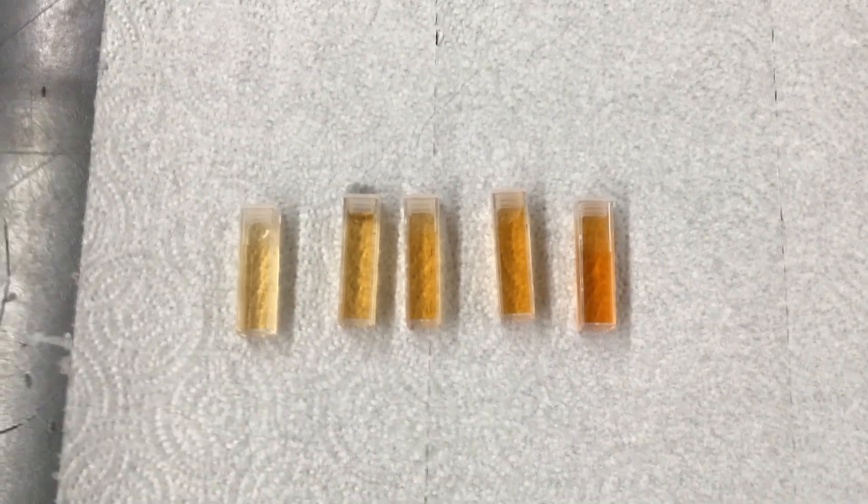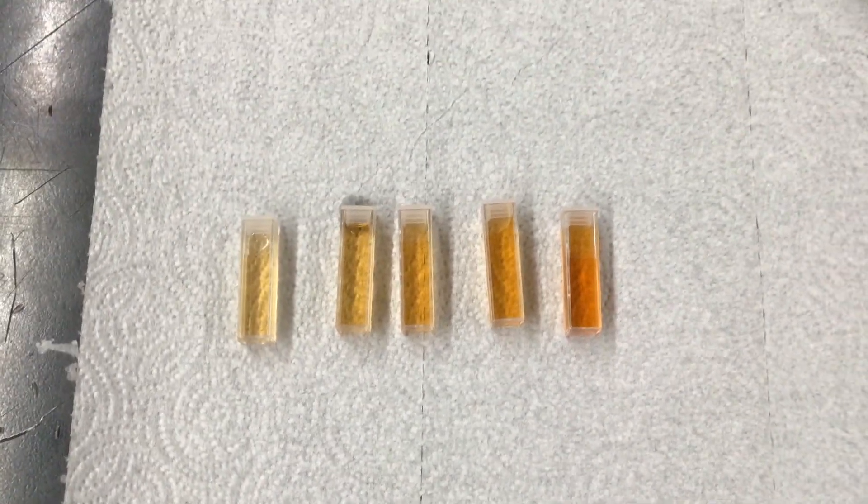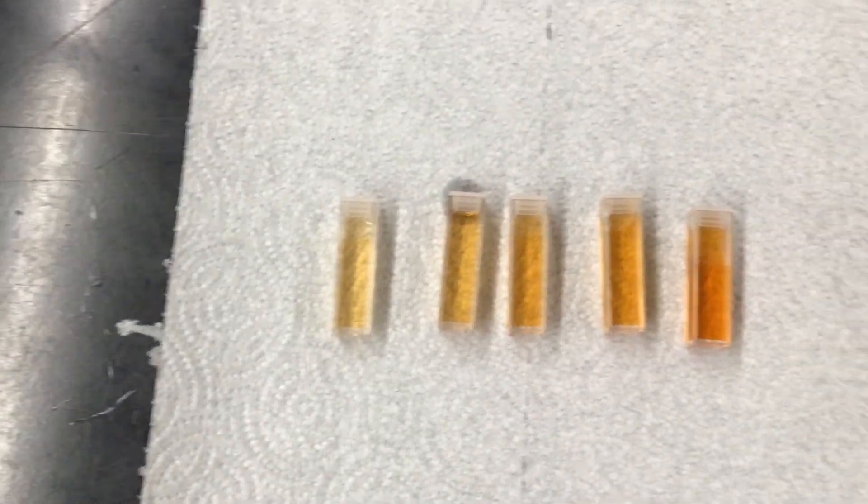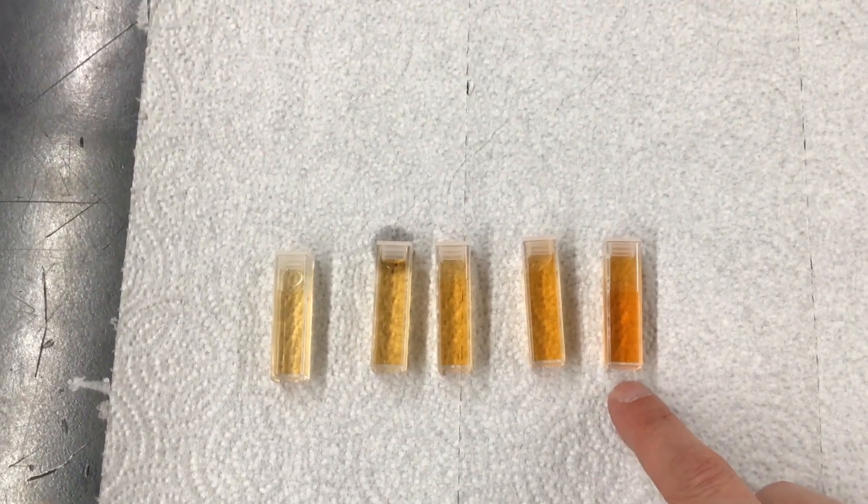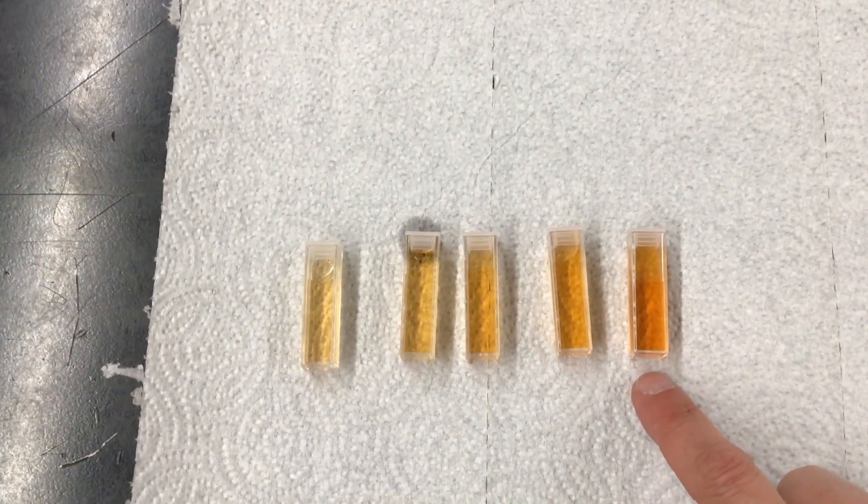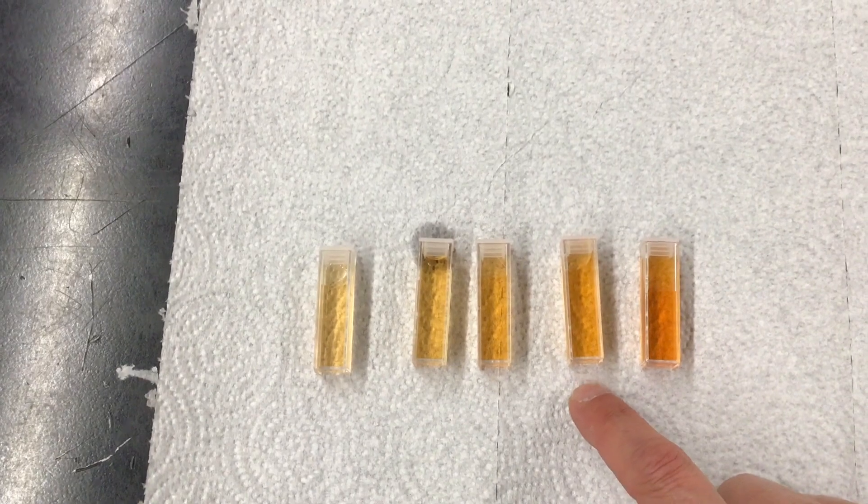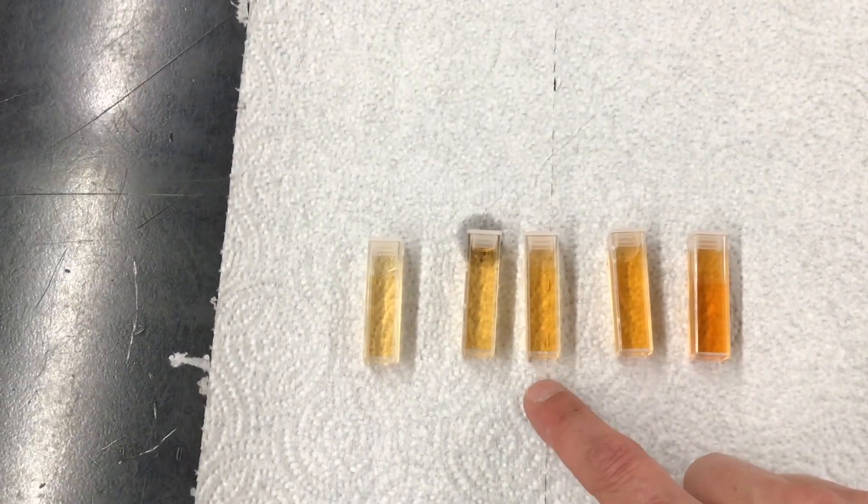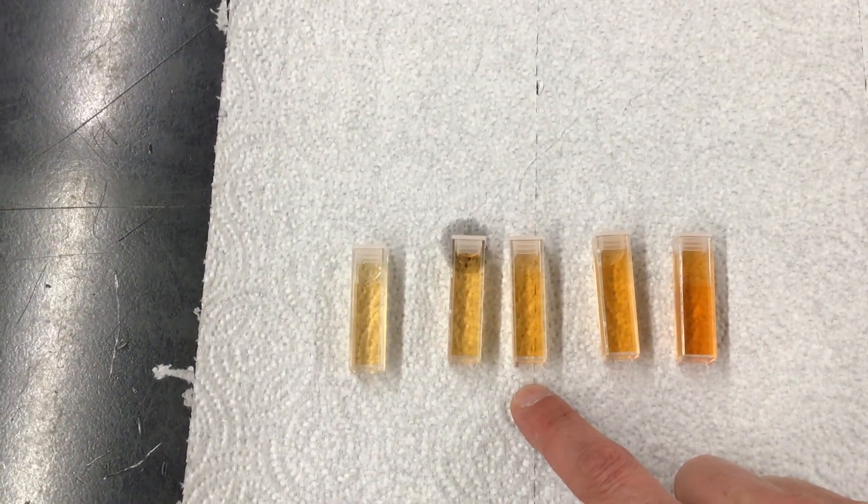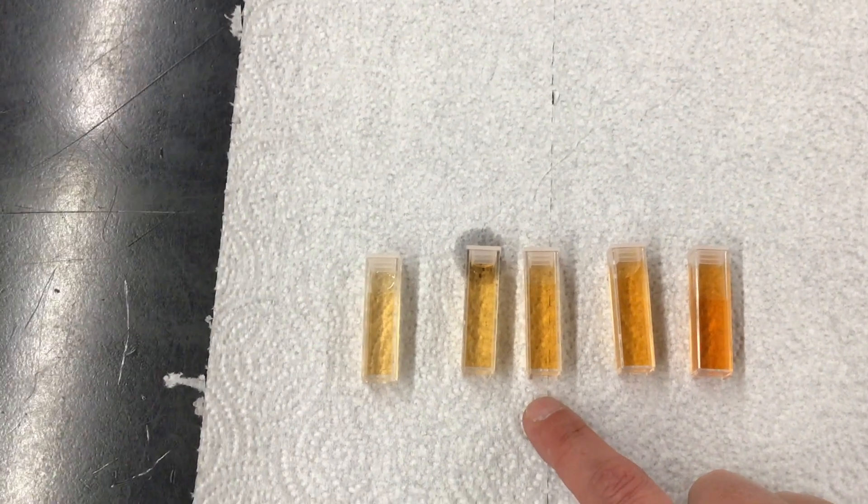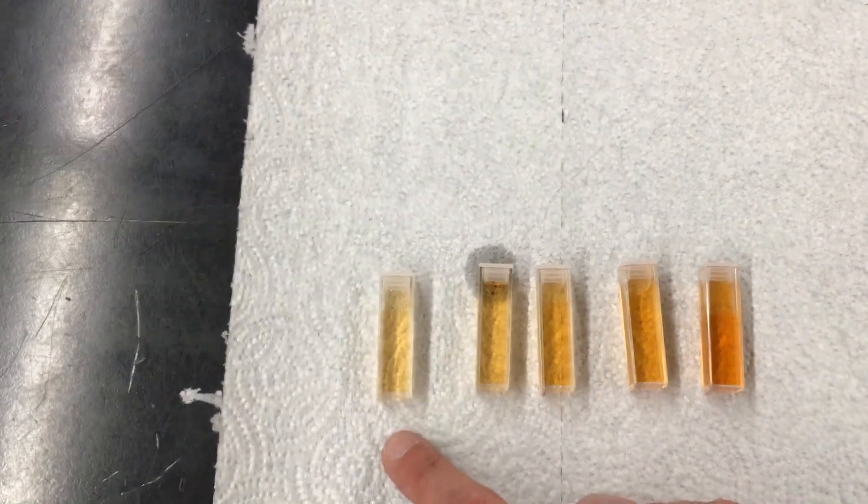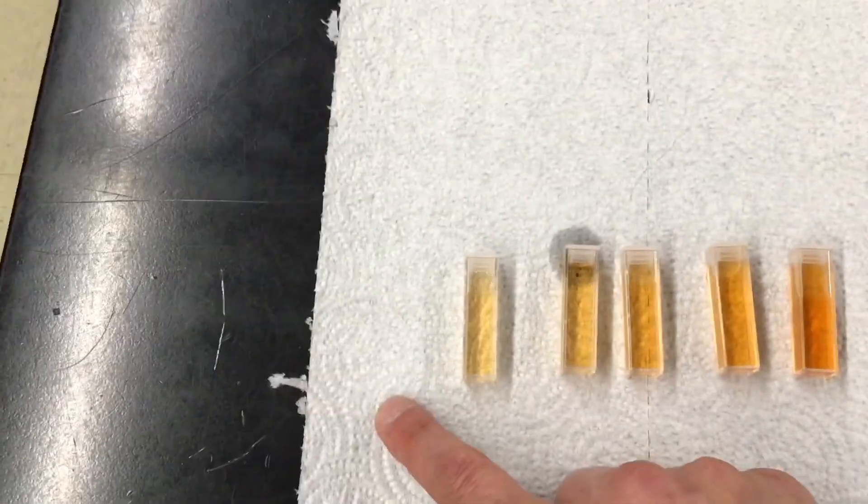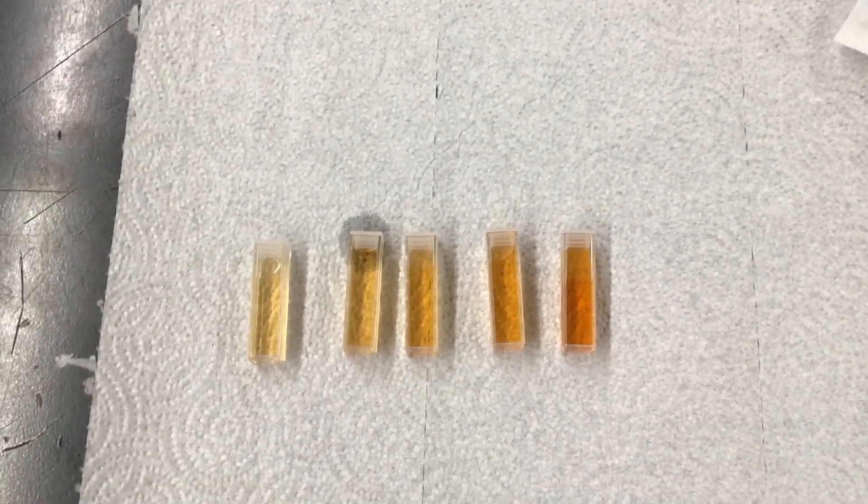Okay, we've taken all our data and I'll have that data on a picture for this video later, but test tube one, two, three, four and then the primary. It's darker. I think this absorbance was like 0.9 something, wasn't it? Yes. And four was how much? 0.557. 0.557 and then 0.454. This one was 0.337 and the next one would have been 0.1 something but you'll see when we do this data you're like wow okay four is plenty.